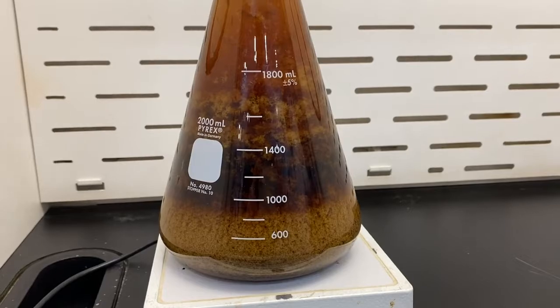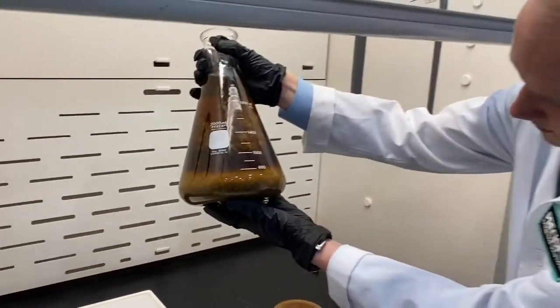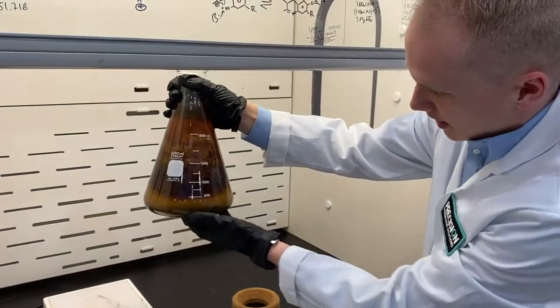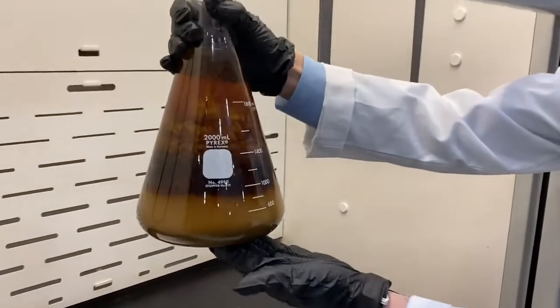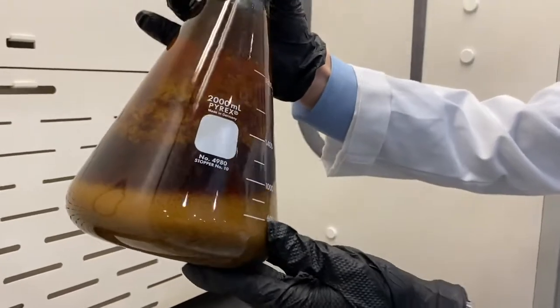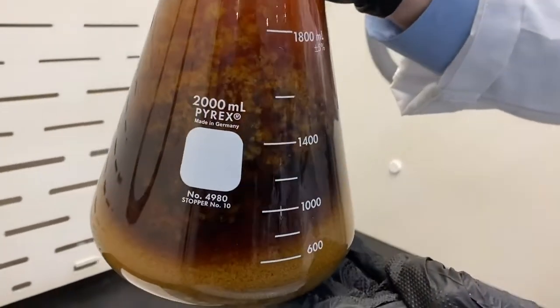I'm going to go ahead and lift this up just so you guys can maybe see a little bit better. So all of that crude oil is now in solution, and you can see these lipids just absolutely, totally crystallized within this solution. Try to get some different angles here for you guys. Pretty cool though.